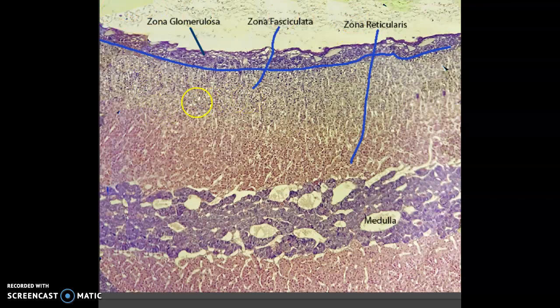But the zona fasciculata is a lot clearer now that I just took the autotones. So I could see this is my strawberry, this is my vanilla in here. So I was pretty close to where the border was, and I'm drawing on the wrong layer now. So I was pretty close, that's where the border was. So those are the zones. This is what our slide was.